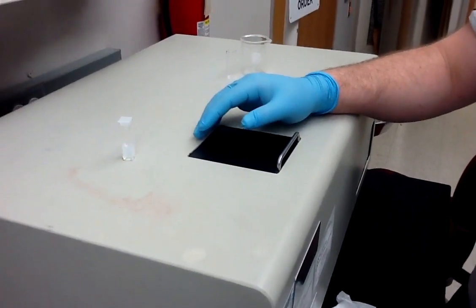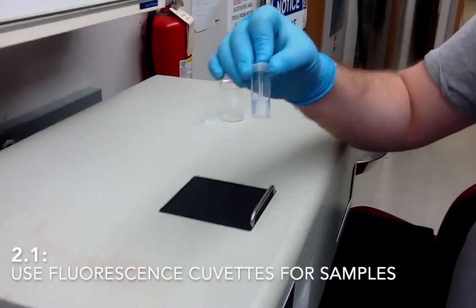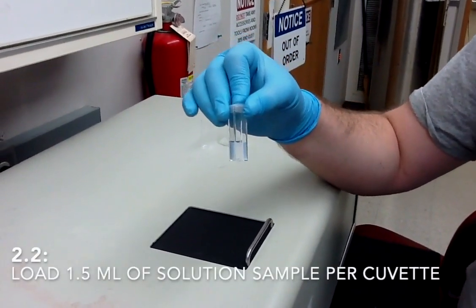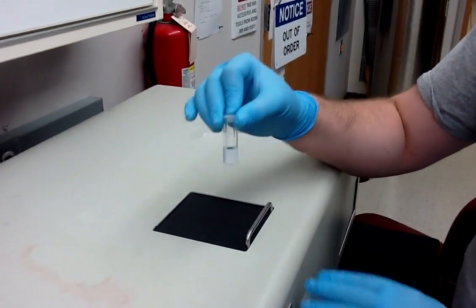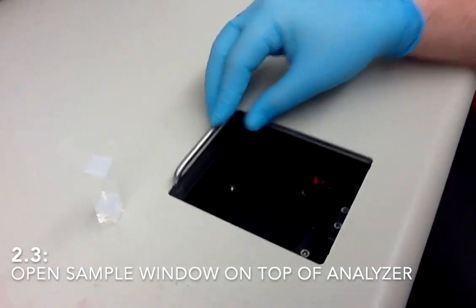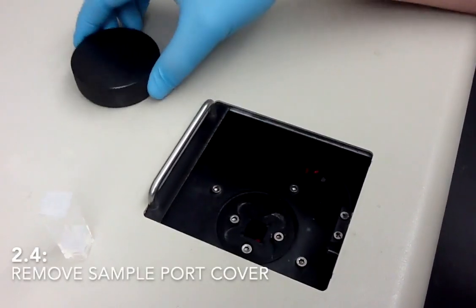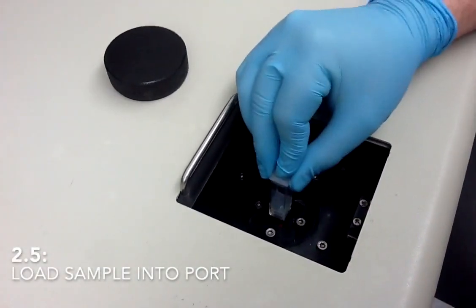Once you have the parameters set, you can then prepare your sample. There are fluorescent cuvettes available at the instrument, which you will then need to load with 1.5 milliliters of your sample solution. Open the sample window, and there is a cover that covers the cuvette, the sample cell. So you can take that out, and then you can load your sample.